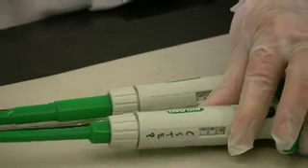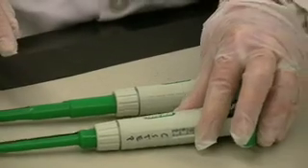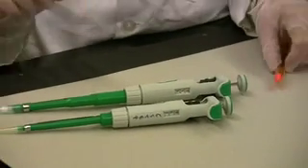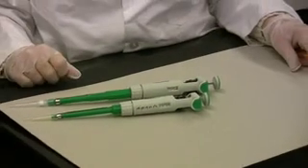You will also notice that these different volume micropipetters come with different tips. It is very important to make sure that you use the appropriate tip for a given micropipetter.